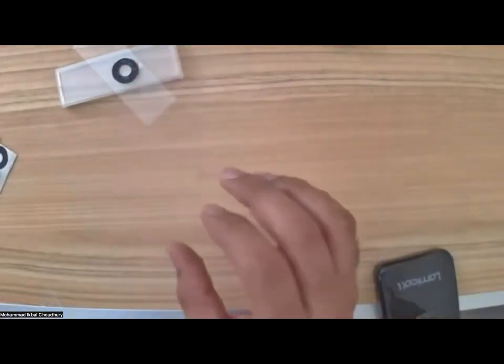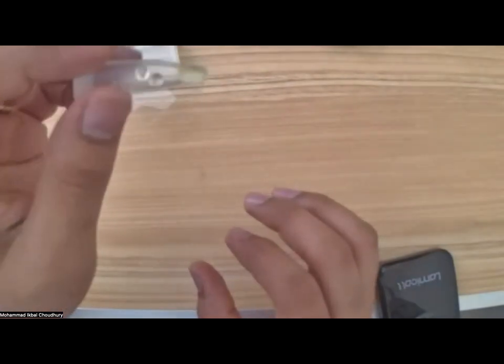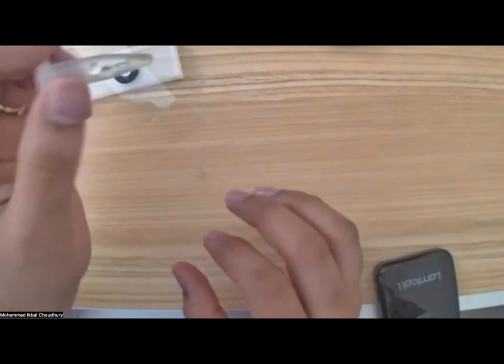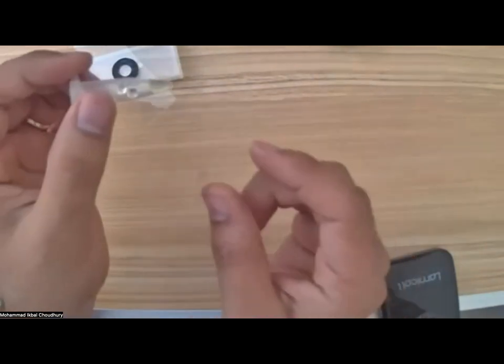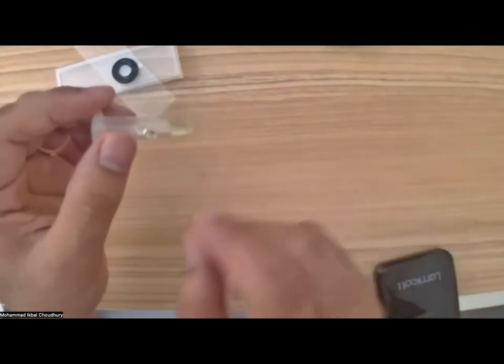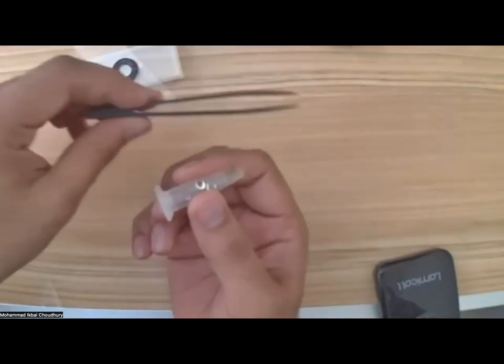Okay, so before starting this program, I was taking a walk and I could find a small sample of algae that was near the road. It was a small puddle of water, and I could see some greenish stuff there. So I scraped that with a forceps. Again, you may have received this as well with the foldscope kit.